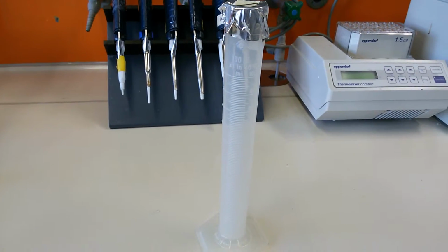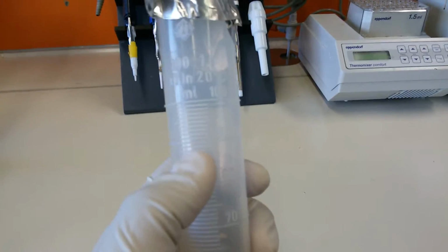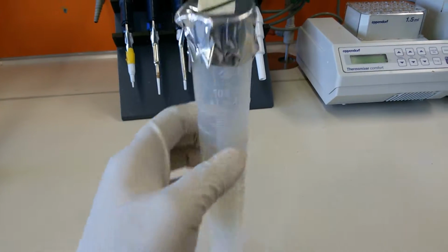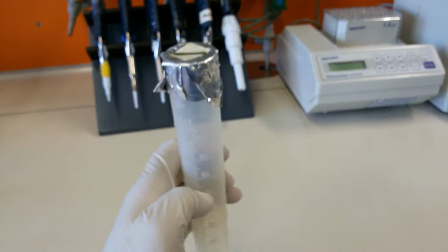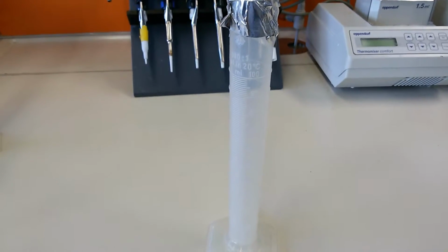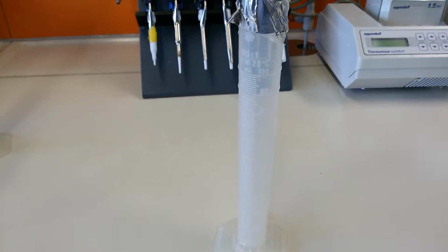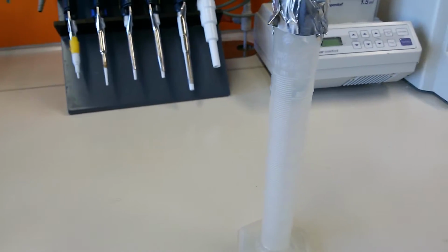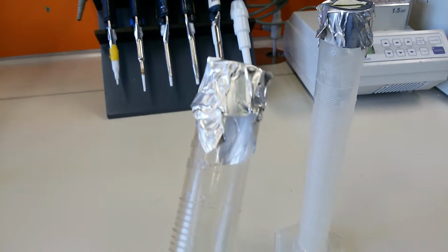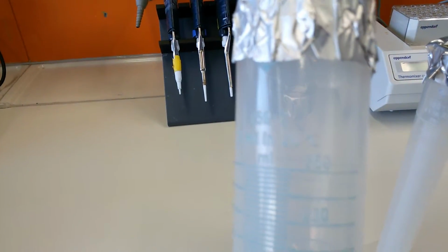So the thing that you see in front of you we call a measuring cylinder. As you can see, it's a 100 ml measuring cylinder, and here you can see 100, 90, 80, 70. That means you can measure a volume of up to 100 ml in this, and we use these measuring cylinders to add water, to prepare buffer, to prepare media, and so on. These measuring cylinders can be of different volume ranges. Here you see a 50 ml measuring cylinder, and here a 250 ml measuring cylinder.